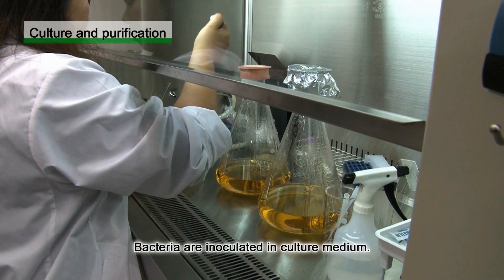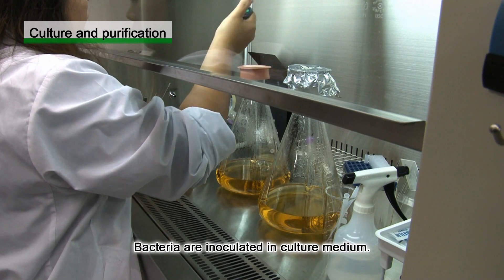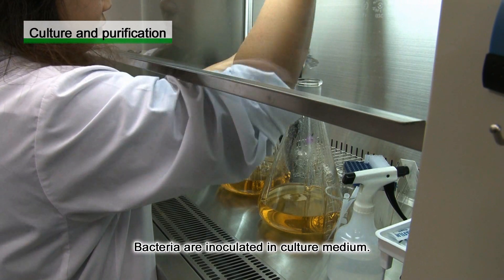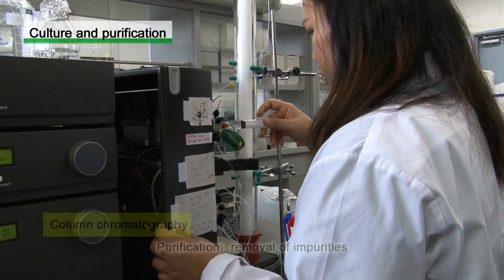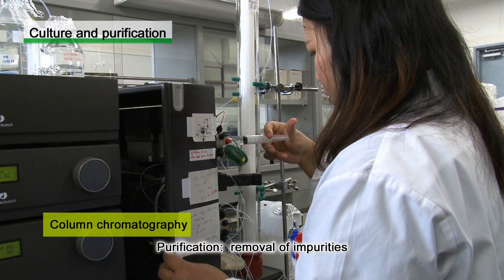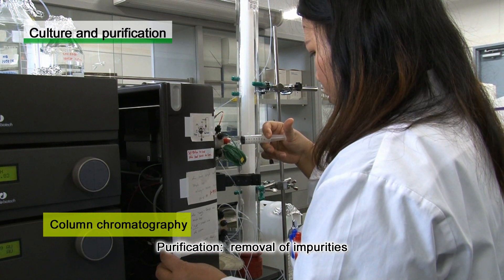Step 1: The preparation of crystals. Firstly, bacteria or other types of host cells that are genetically modified to produce the target proteins are inoculated in a suitable medium. Next, the target protein extracted from the bacteria or cultured cells is purified by column chromatography.